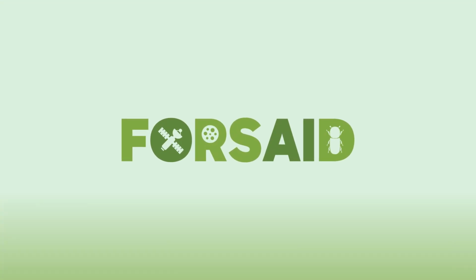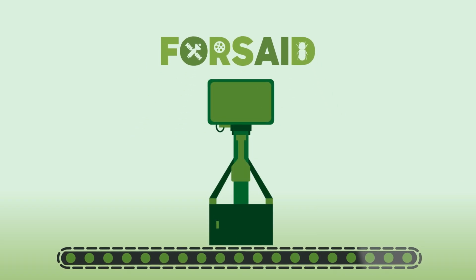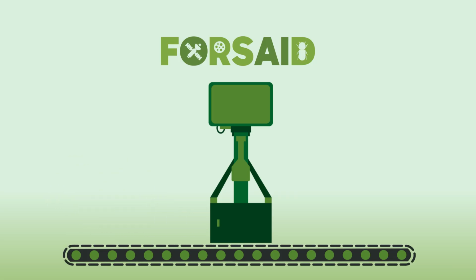this identification process. The Entomoscope is a photomicroscope for capturing small objects in great detail. In FORSAID, it is used to train artificial intelligence models with standardized photos of insects for the purposes of automatic species classification.